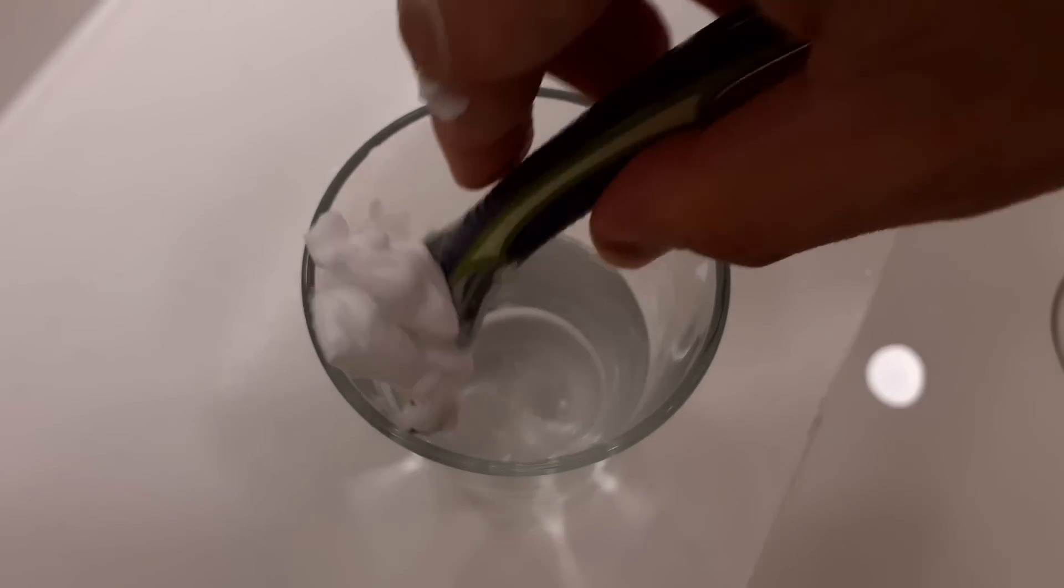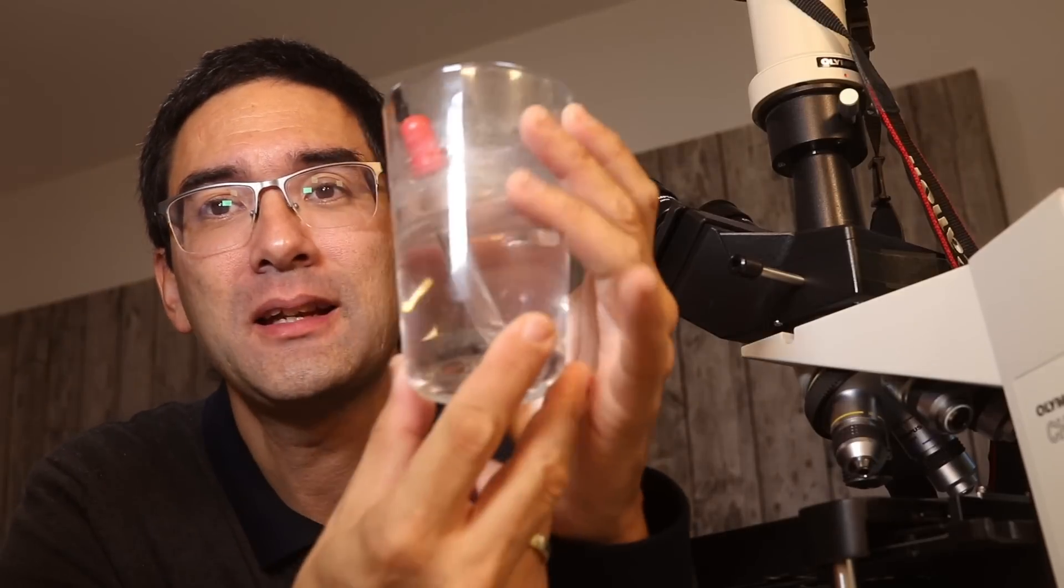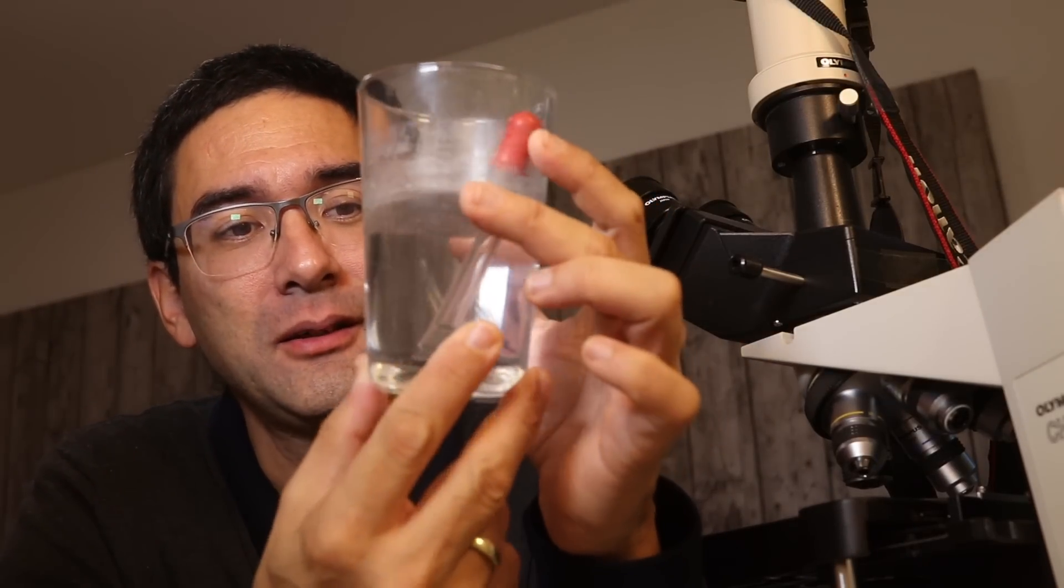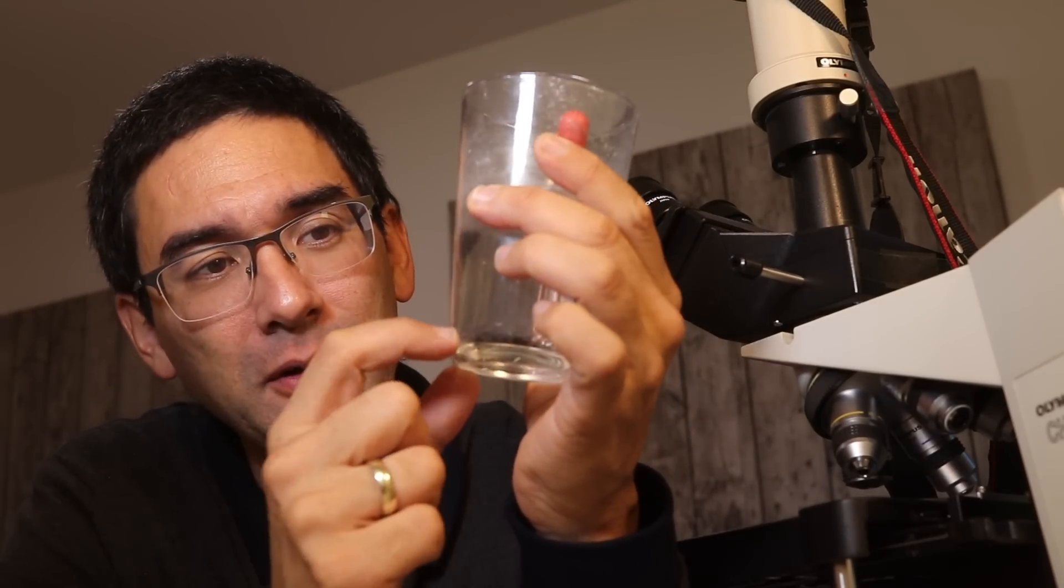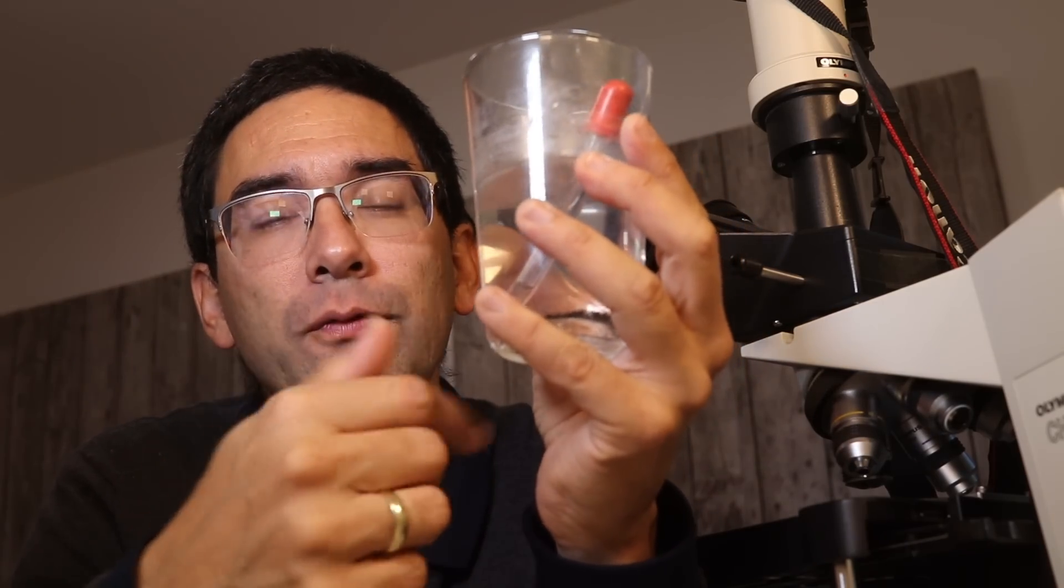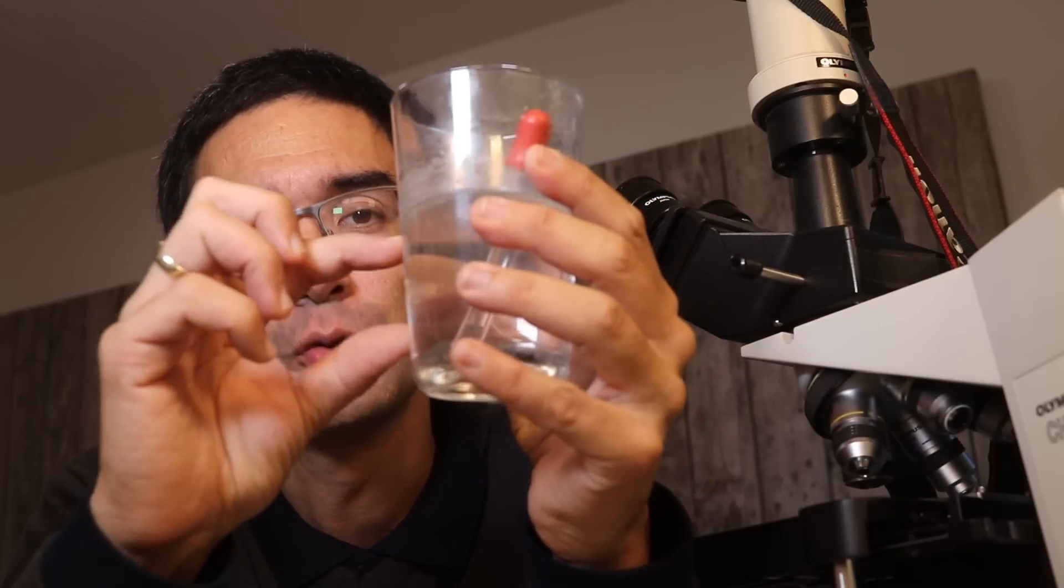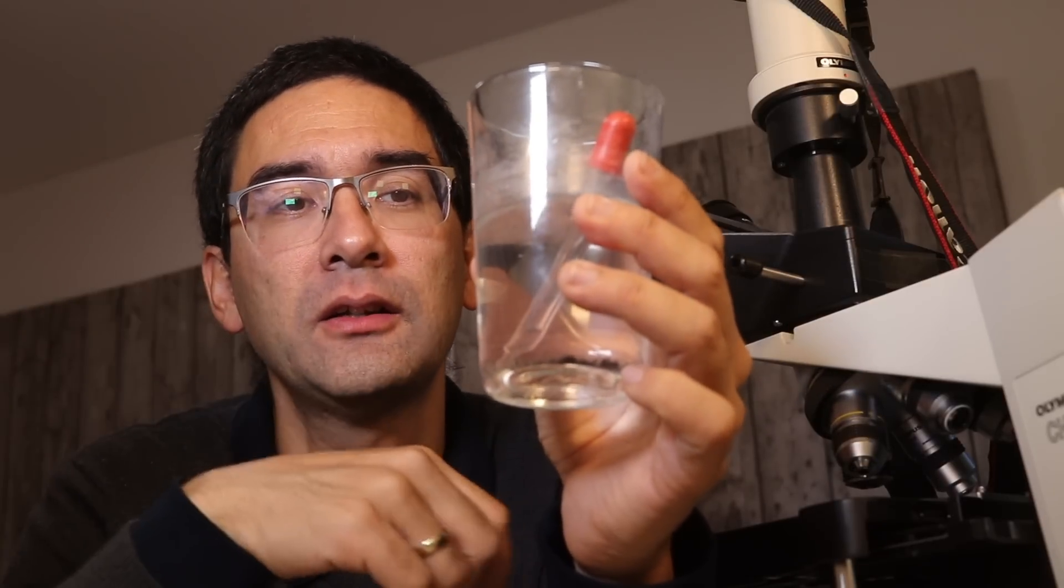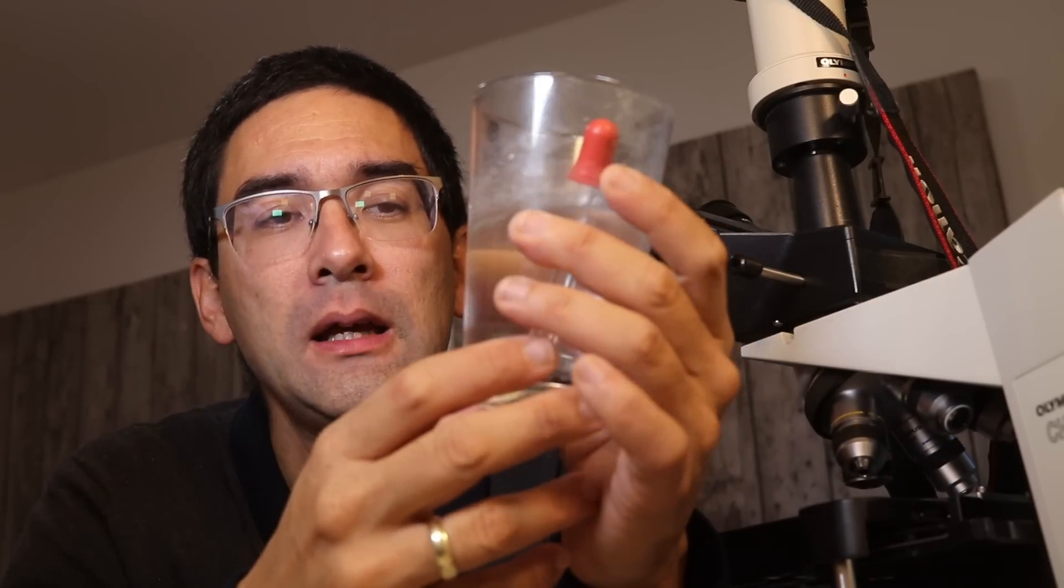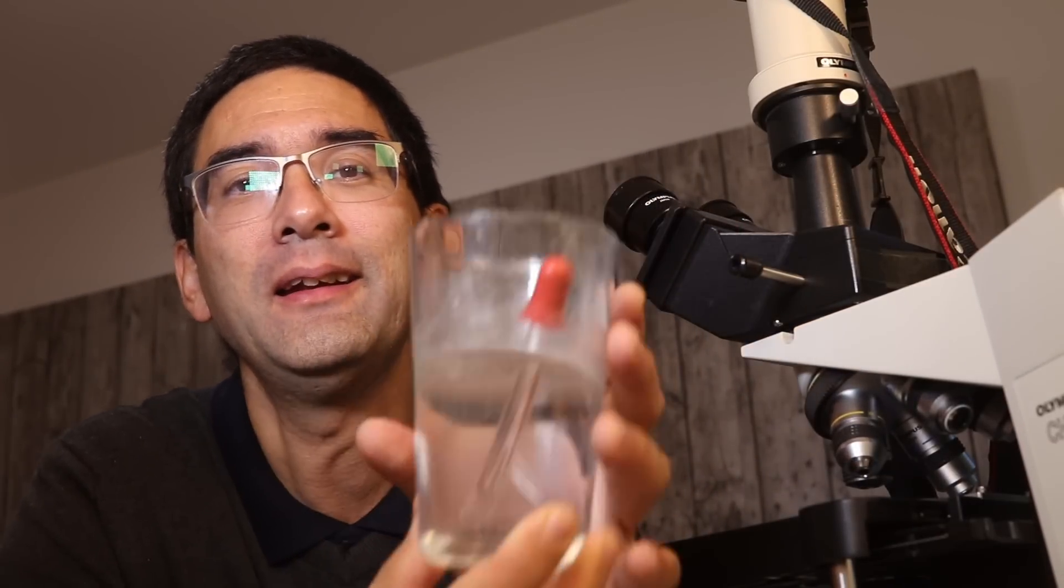I wanted to have a look at some of the beard clippings using my compound microscope. That's the cup with the beard here and it looks kind of clear because I rinsed the beard a few times. I poured off the supernatant and added clear water to remove the foam, then let it stand for a few days so the beard could settle down.